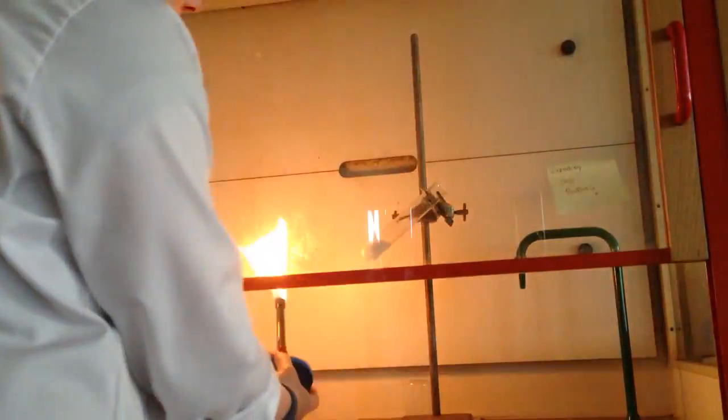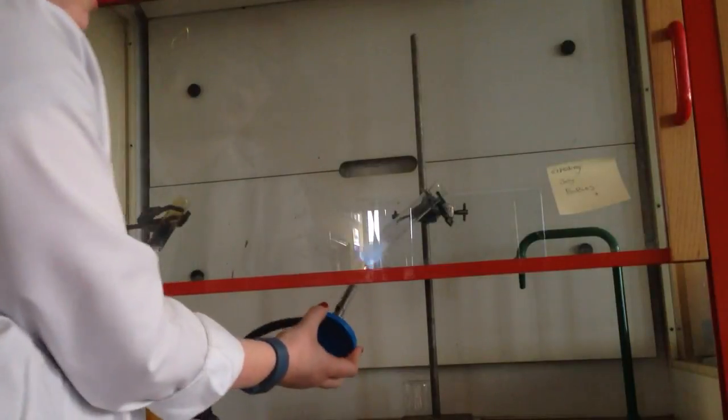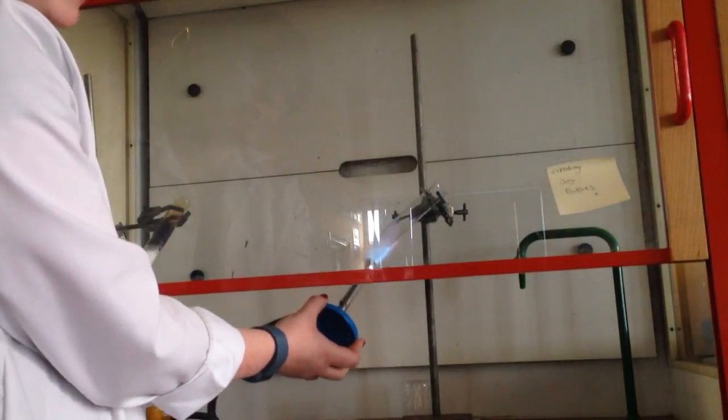Hello and welcome to this video. This is a special request for my year 9 class, the Screaming or Exploding Jelly Babies.